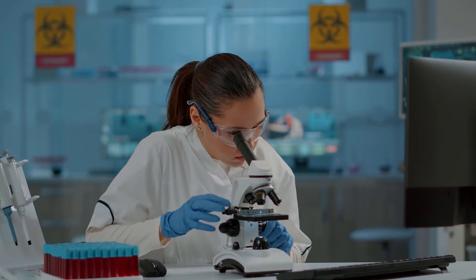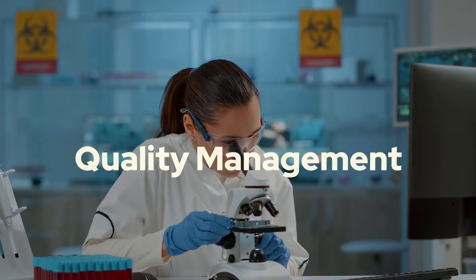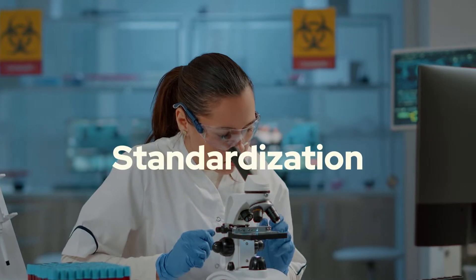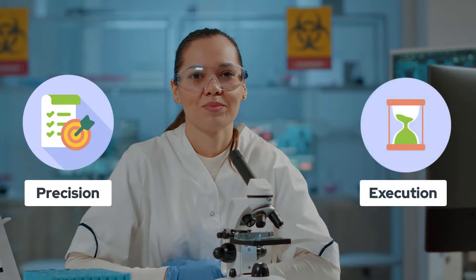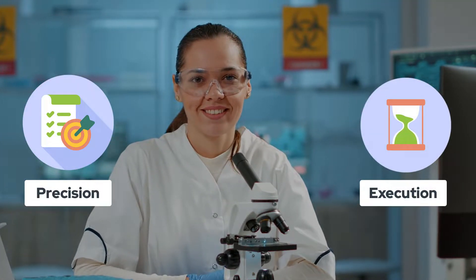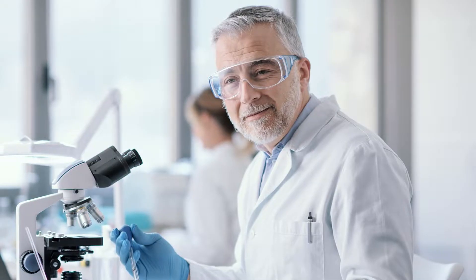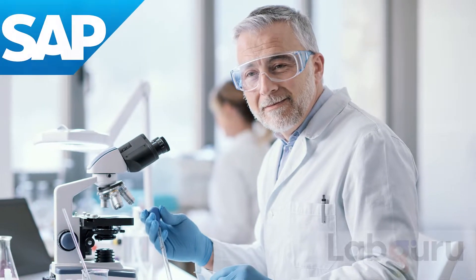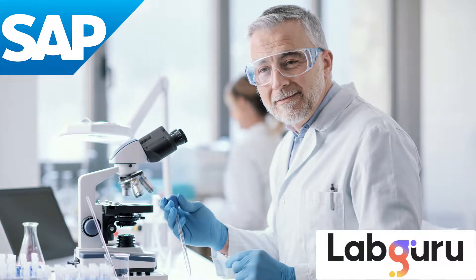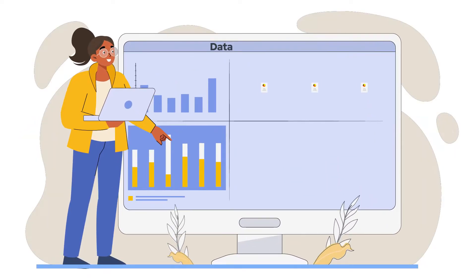Multi-step processes in quality management necessitate meticulous planning, standardization, precision, and timely execution. These principles are at the heart of the innovative solution set brought forth by SAP and LabGuru. LabGuru is your cutting-edge solution to lab data management.